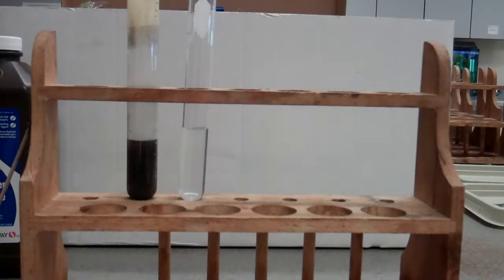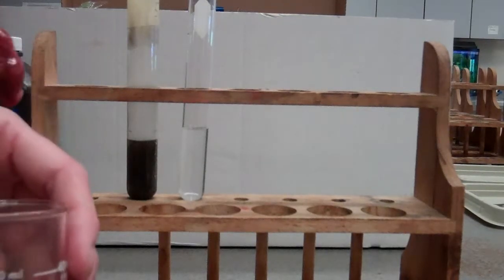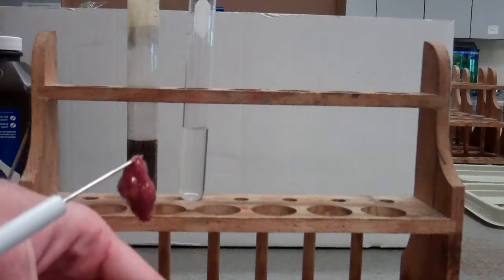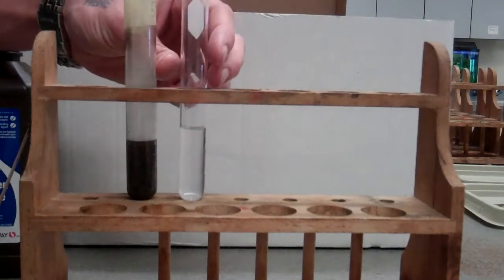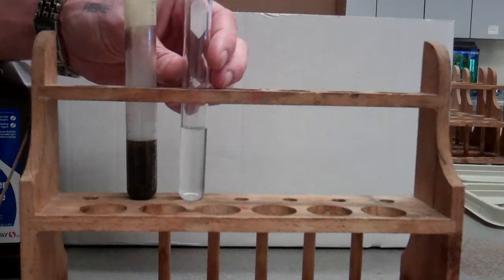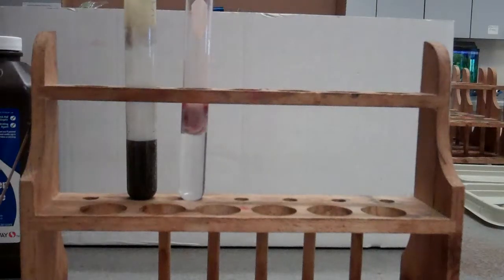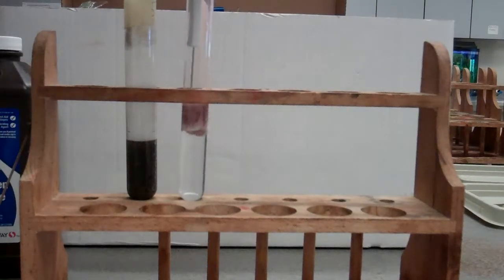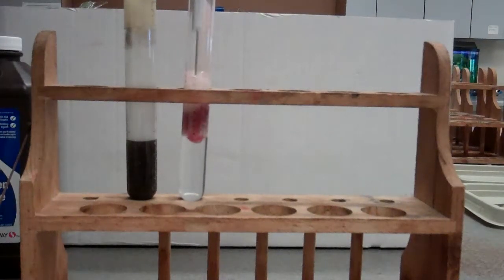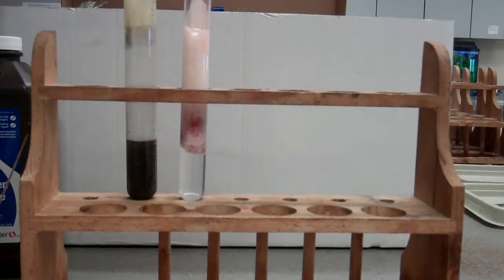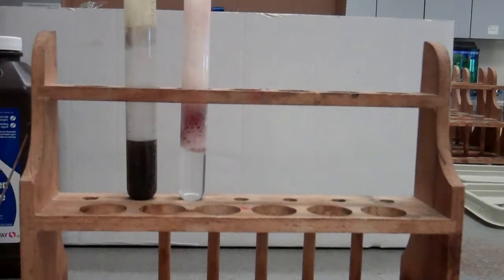Now, we can do the same thing with a biological catalyst. So this is chicken liver, and this is something that contains a biological catalyst, an enzyme called catalase. And so we can put that in there and we can see these bubbles start to form. And it's going to keep bubbling and bubbling.